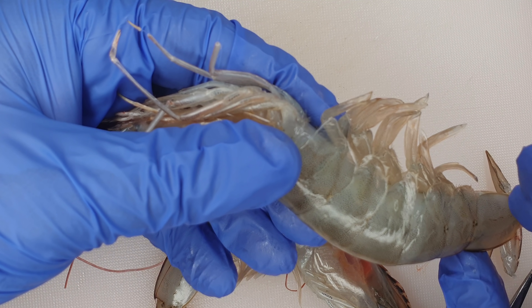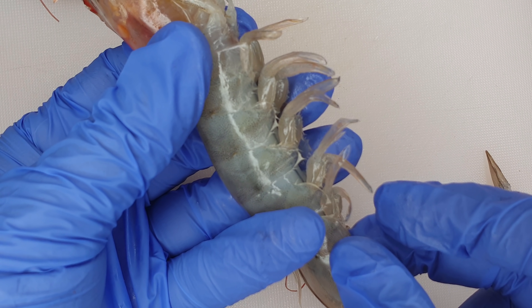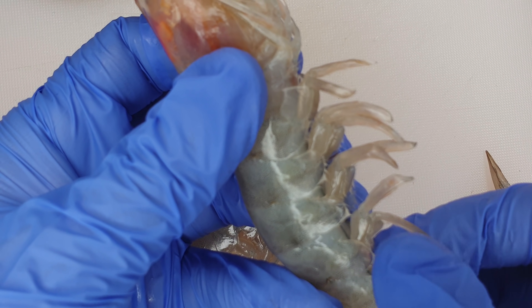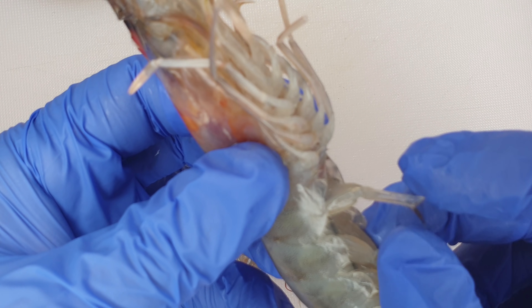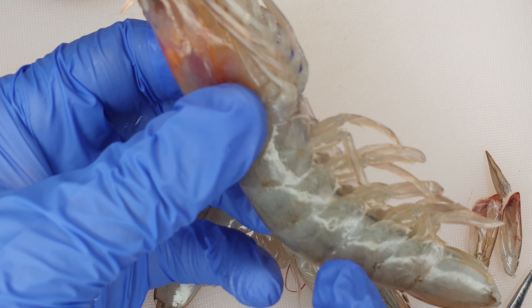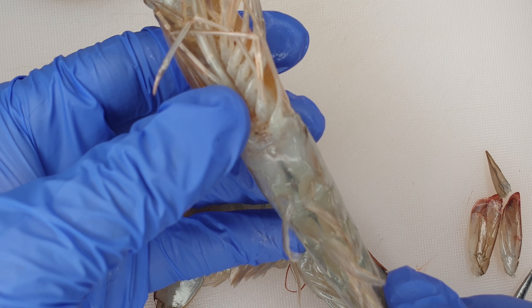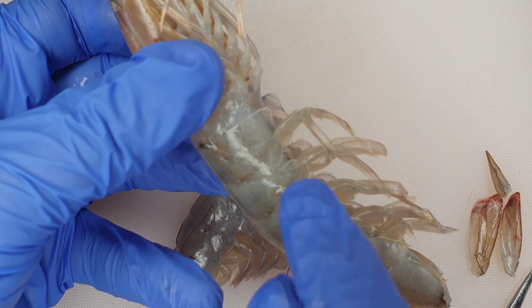After the telson and uropods, we have the fifth, fourth, third, second, and first abdominal segments. Every single abdominal segment of the first through fifth has swimmerets, also referred to as pleopods. They are five pairs. Their function is creating water currents and transferring sperm — this is only for males. We will go into sex determination shortly.